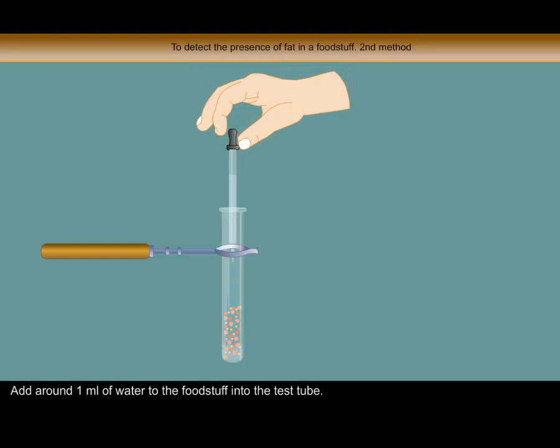Add around 1 ml of water to the foodstuff into the test tube.